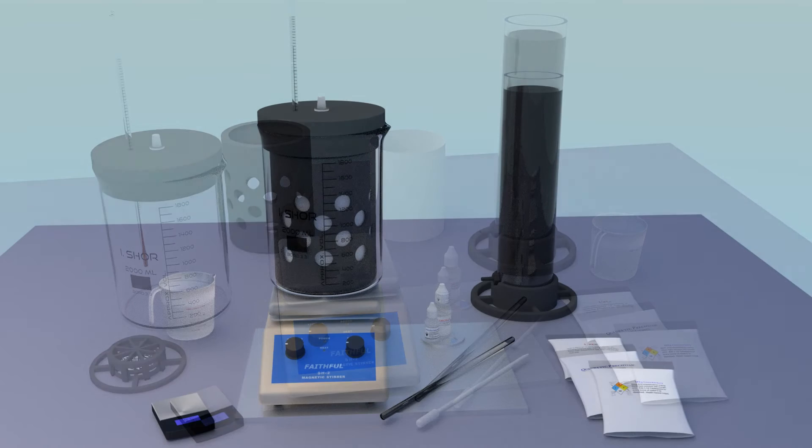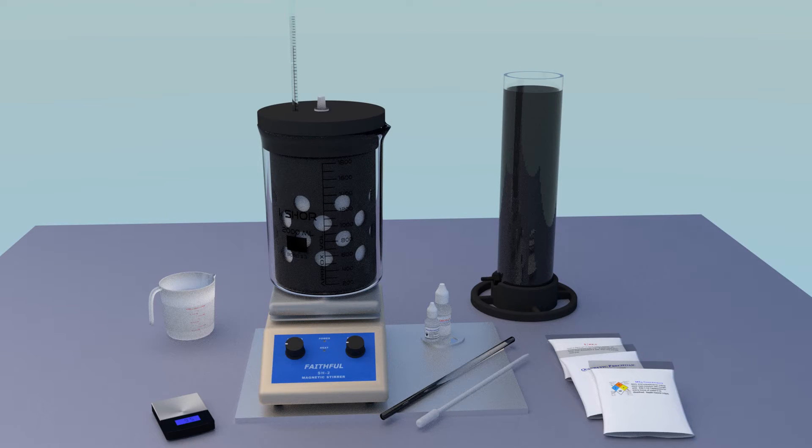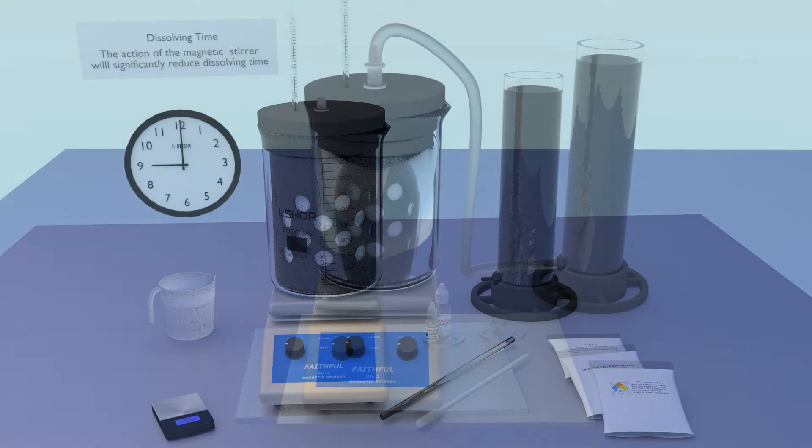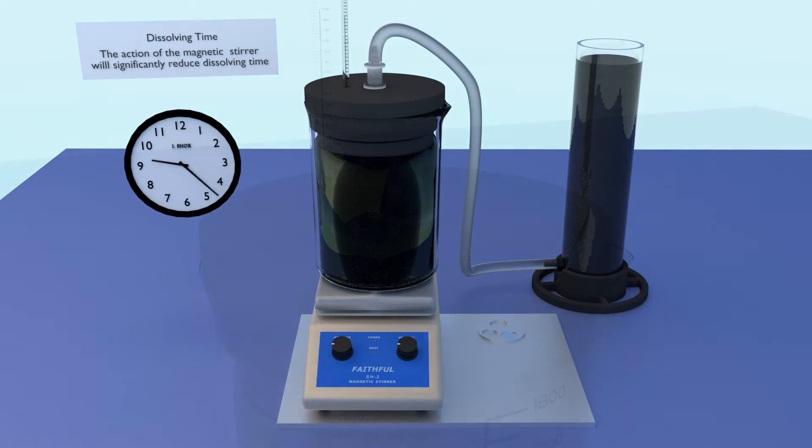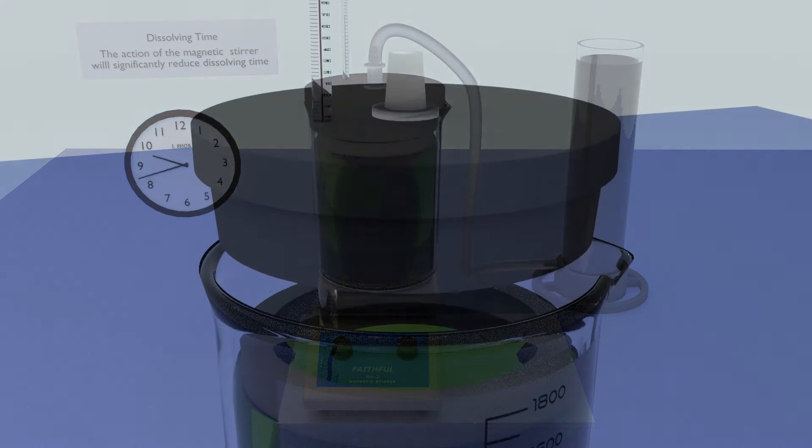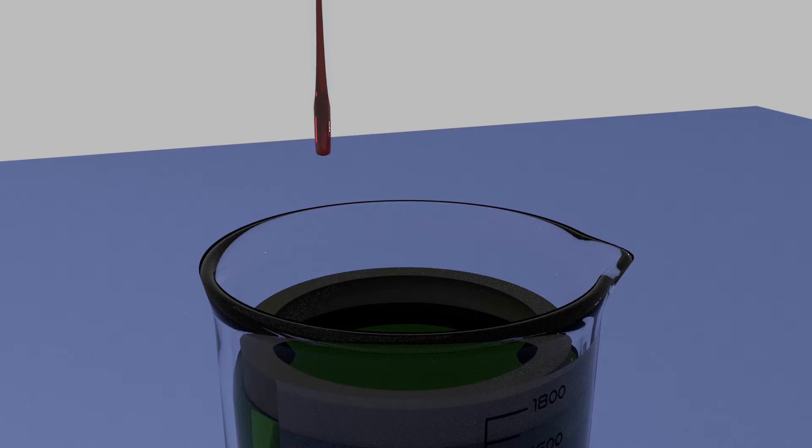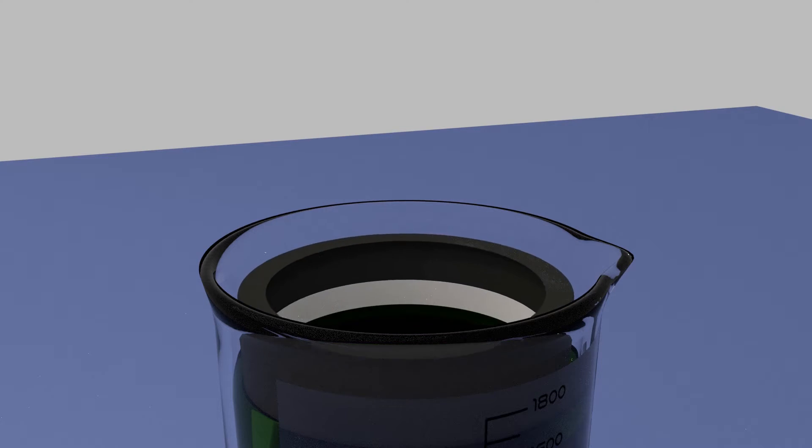The process is pretty simple and straightforward with just a few easy steps. Metal is dissolved into solution. Stones and other materials that didn't dissolve are separated from the solution by removing the basket and filter pouch.